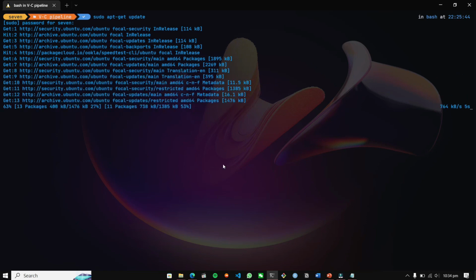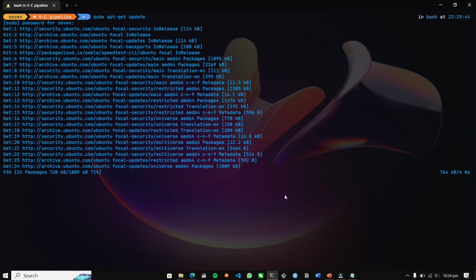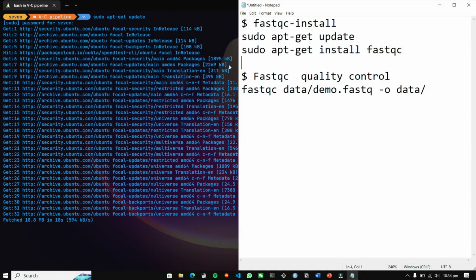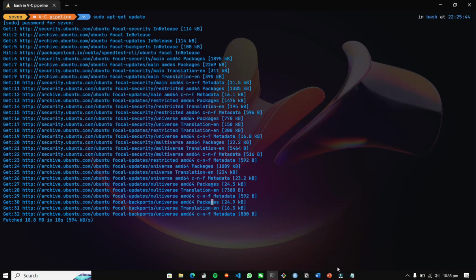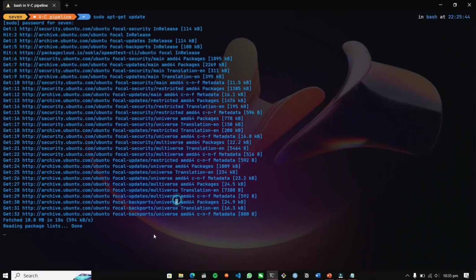While the system is updating, let me tell you about the FastQC tool. You can install FastQC by using this command. It is available in the APT system of our Linux and Unix terminals. I have already installed these tools, as I have done a lot of analysis on this computer as well as on other machines. So in this terminal, all the tools are available.